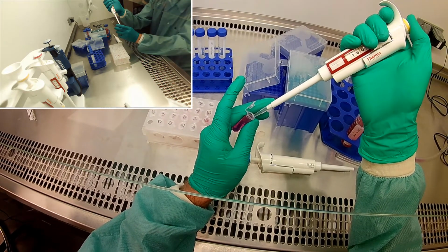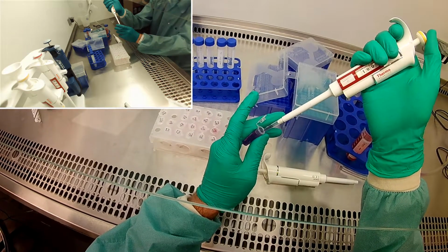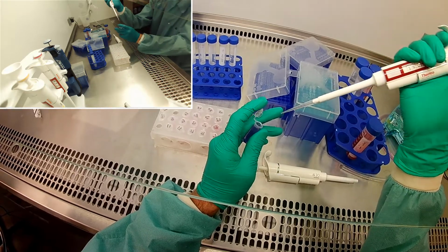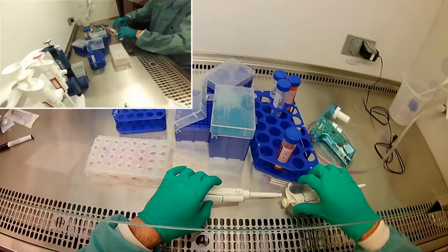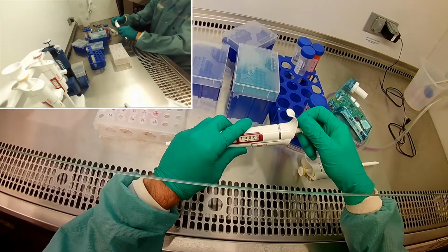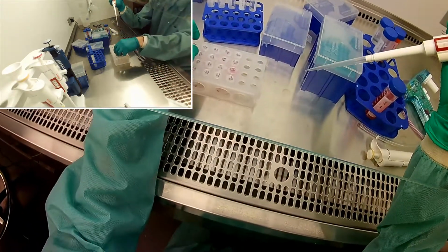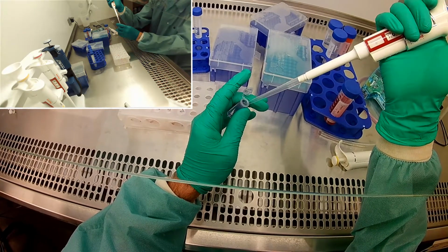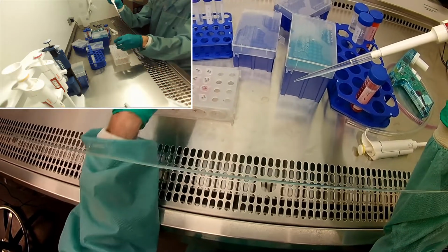All right, you can tell it definitely changed the pH as well because this thing turns very purple. That is what bleach does. And now we're going to go ahead and take 1 ml of the 8%. We'll mix it in the 4%.